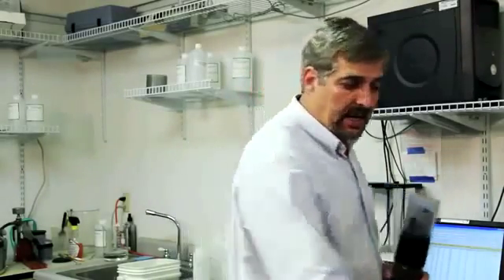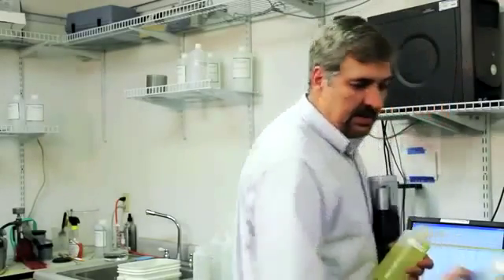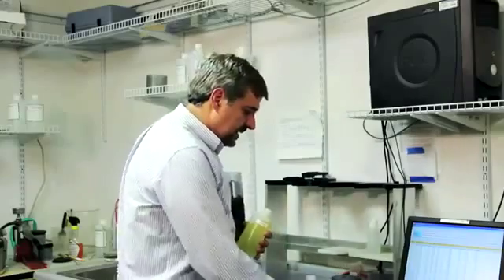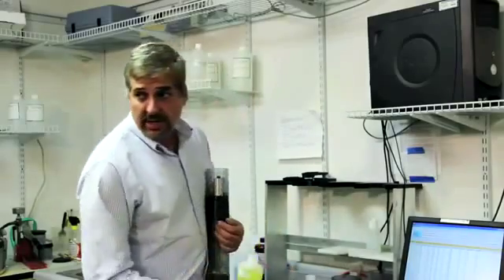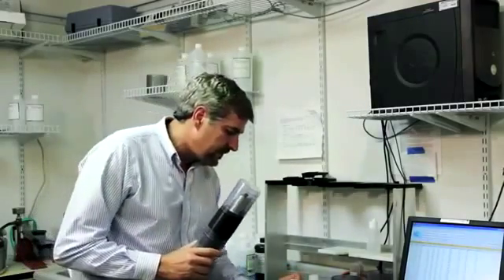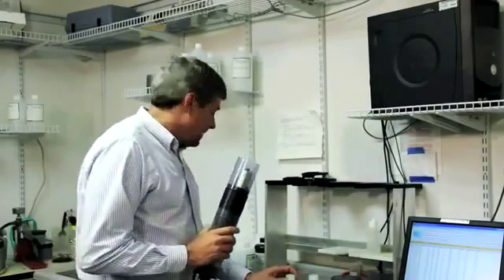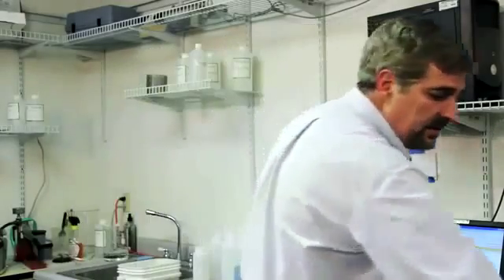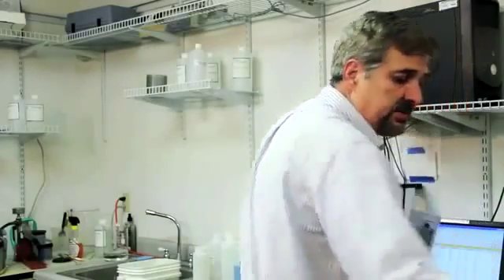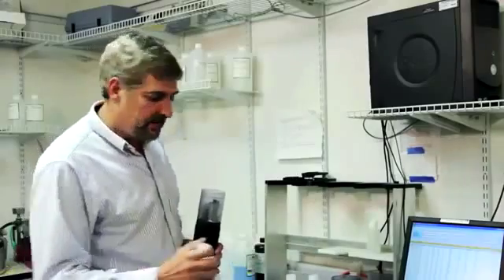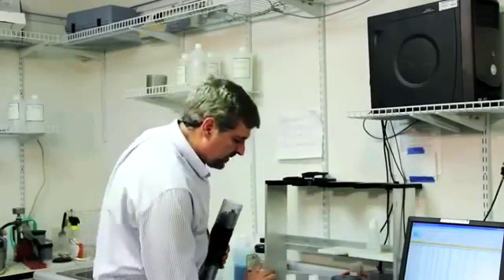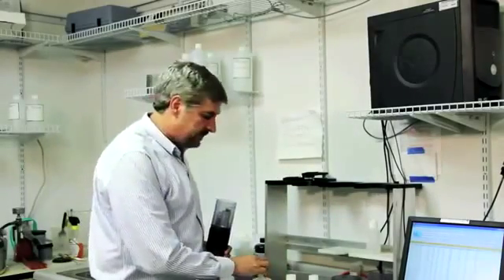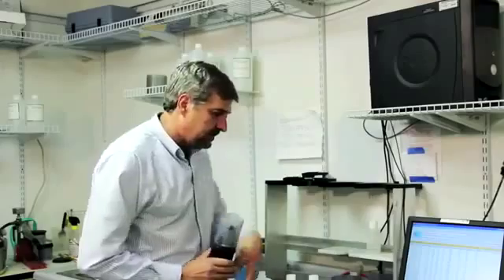First, I'm going to calibrate pH, which I have my pH 7 and my pH 10. I do a two-point calibration. You have the option of doing three, but I've never seen any improvement doing the three-point over two-point. One thing I always do is keep all my solutions with me. This way I can do calibration out in the field. I'll keep a bottle of DI water so I can do a rinse.